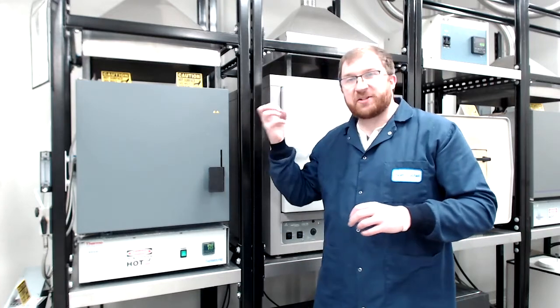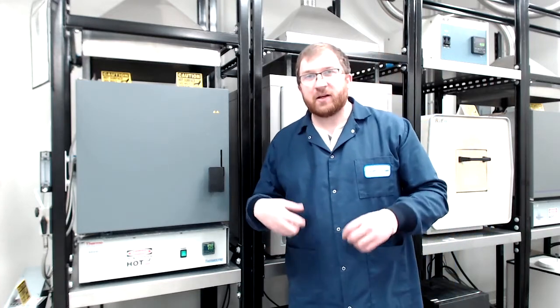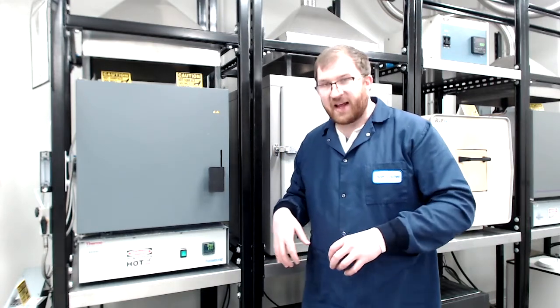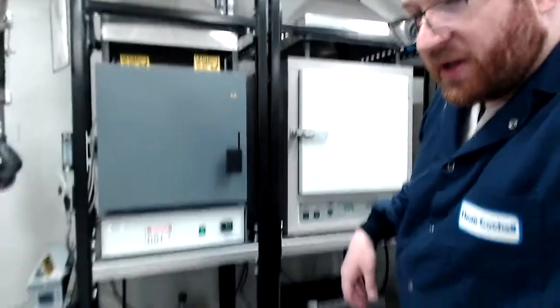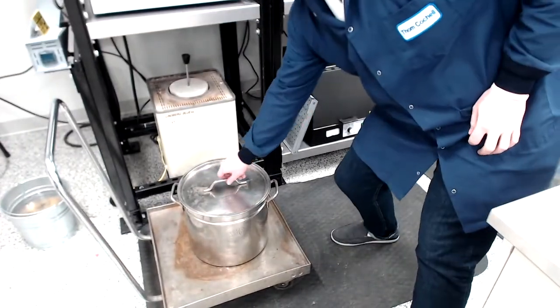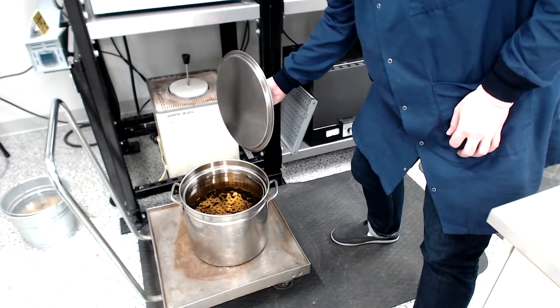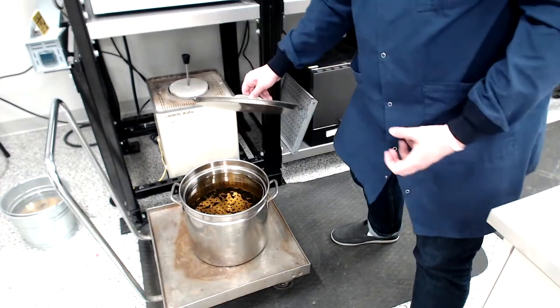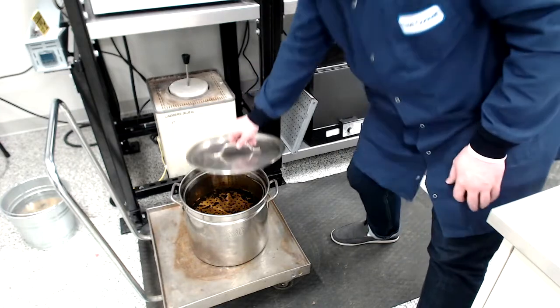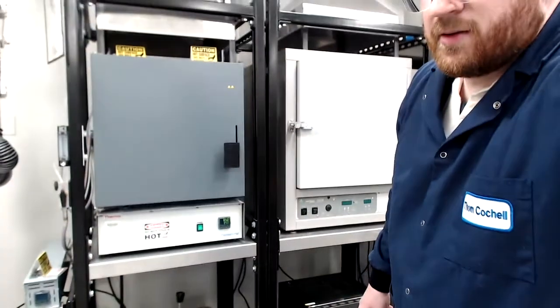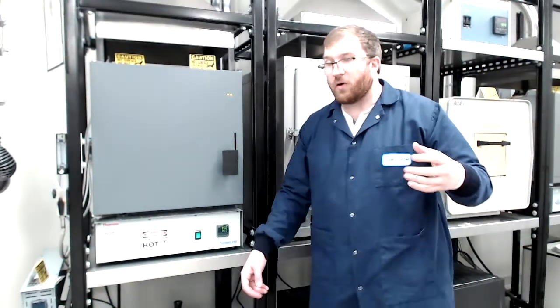And then we're going to quench or rapidly cool them to room temperature in a quenching oil. And so we've got the quenching oil in a bucket down here with a lid on it right now, but if we open it up, we'll see that we have our quenching oil, and we actually have a basket that we can lift up with our samples. So that's what we're going to do.